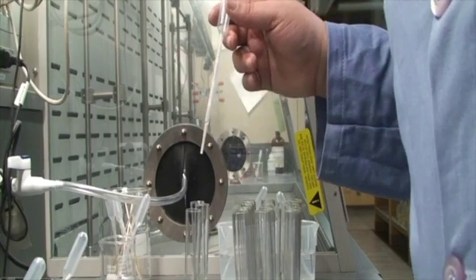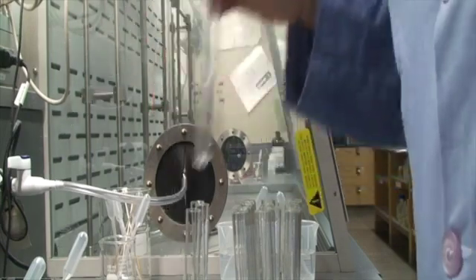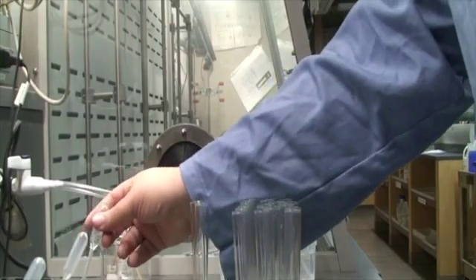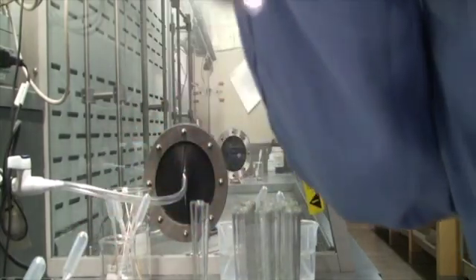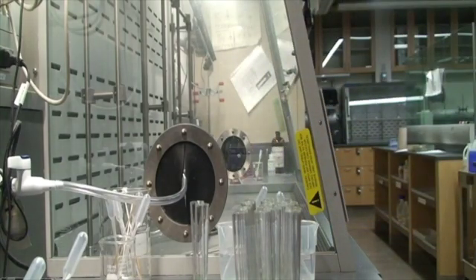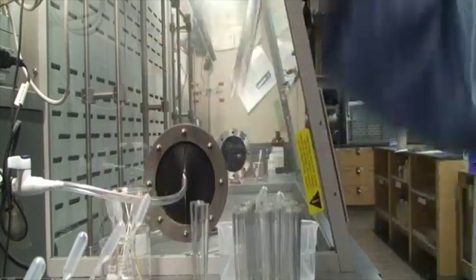I don't know, I think I saw a little bit of gas there, so let's try that one again. We're going to try 9 and 13 one more time. I'm going to try it with less reagent. So here again is 9. We got 1 milliliter of 9, and 1 milliliter of 13. There is definitely bubbling there. Definitely bubbling. Okay, sometimes it's good to do tests twice if you're not sure. Okay, that was 9 and 13.